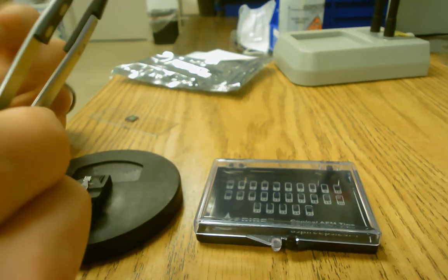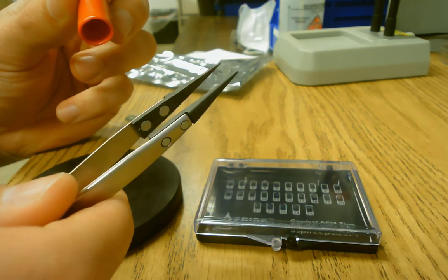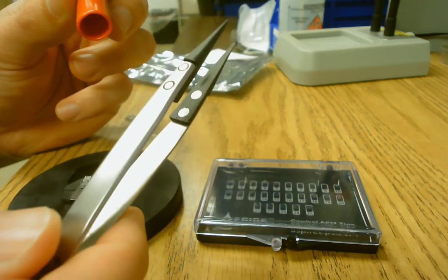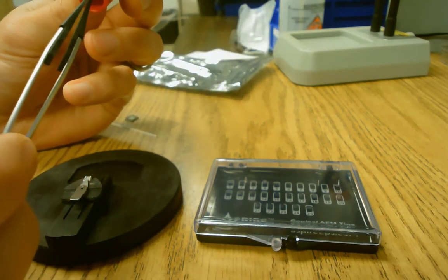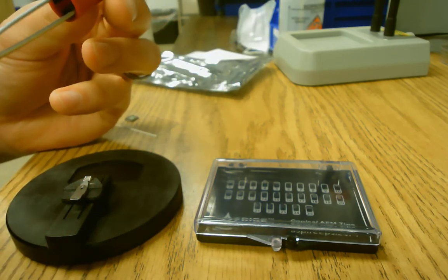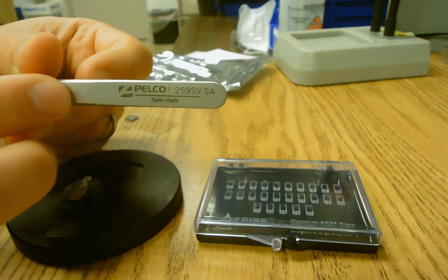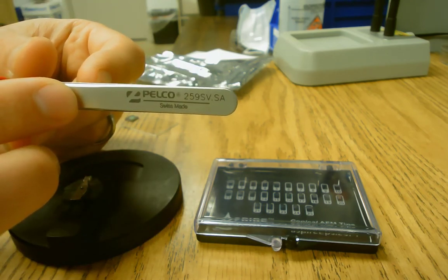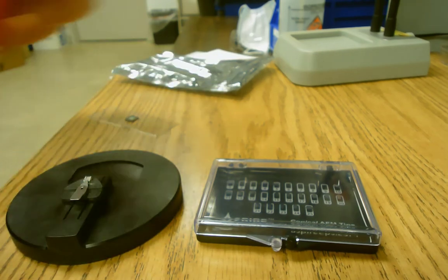We are going to use these specific tweezers for grabbing and moving the tips. And we use them for nothing else because they are specialized tweezers. They're static free carbon fiber reinforced tweezers that are quite expensive. So we only try and use them for grabbing the tips and nothing else.